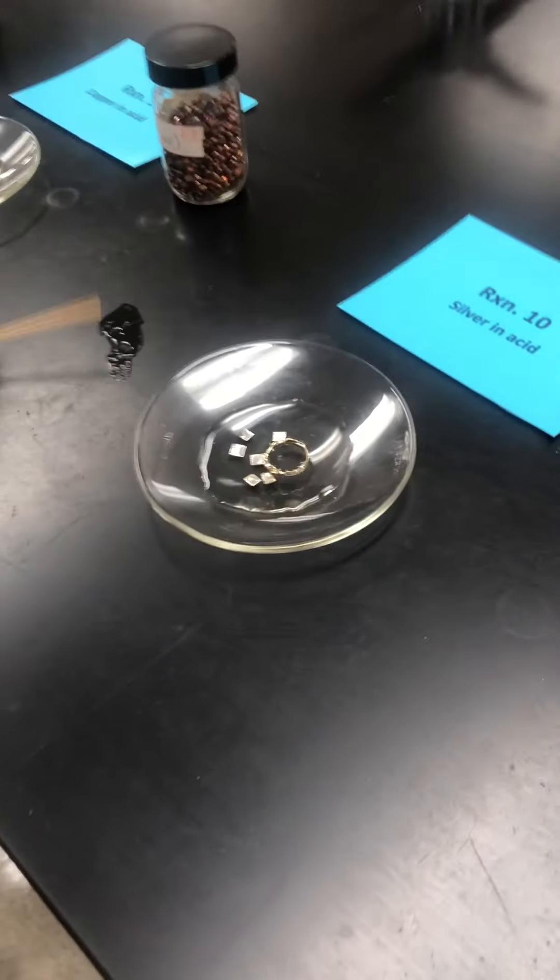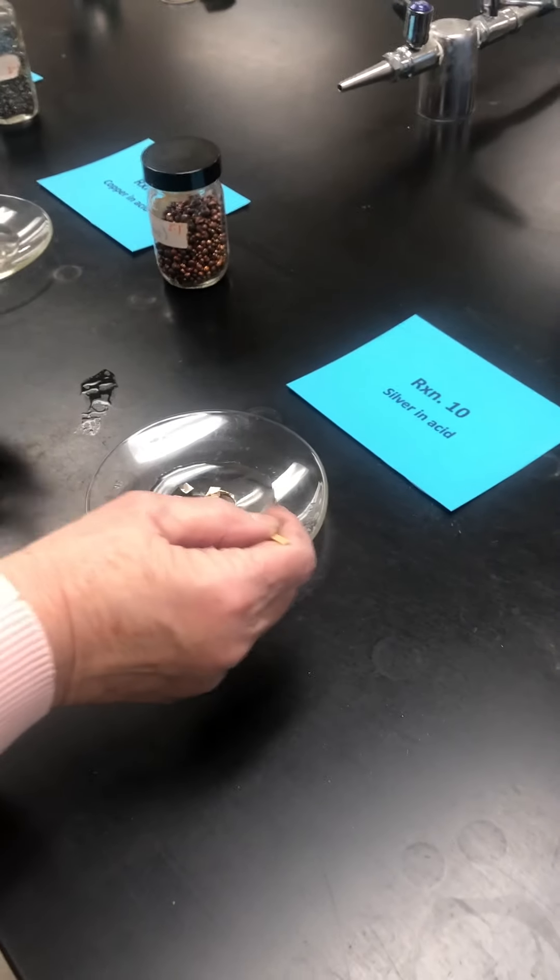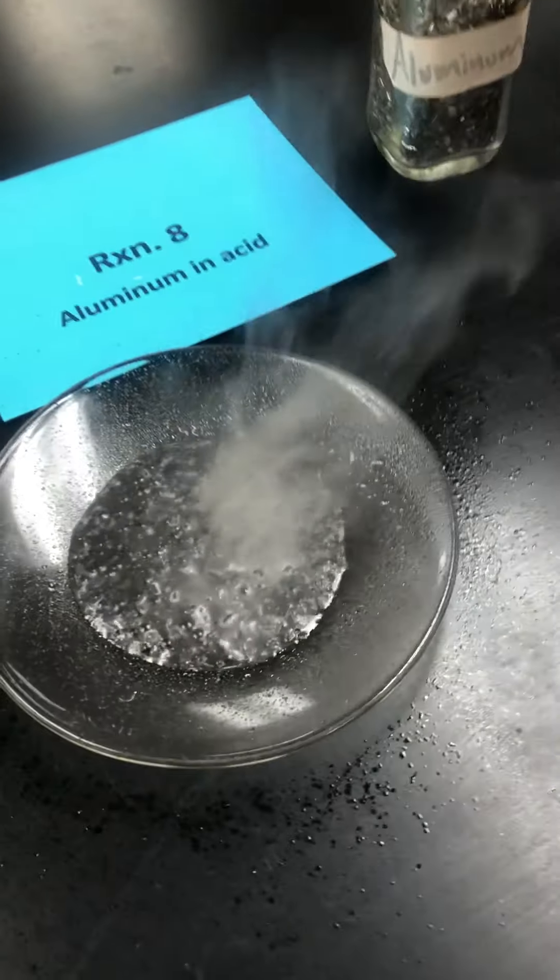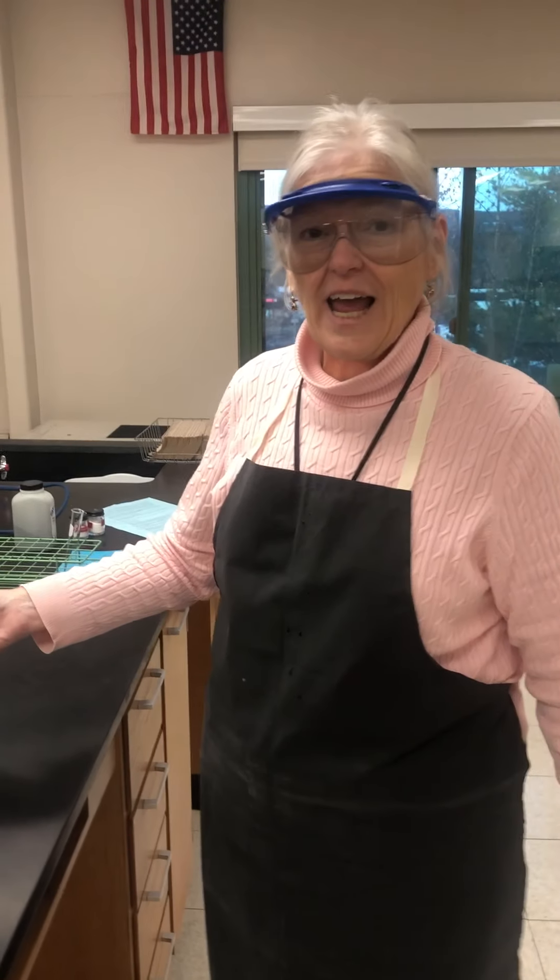Your job is to now write these chemical reactions if they occur, or say no reaction if the reactions do not occur. Thank you. That's the end of seven, eight, nine, and ten.